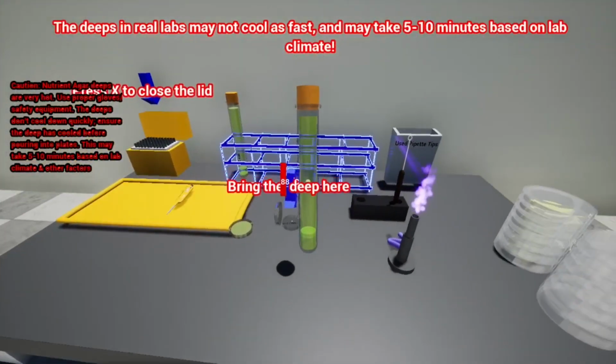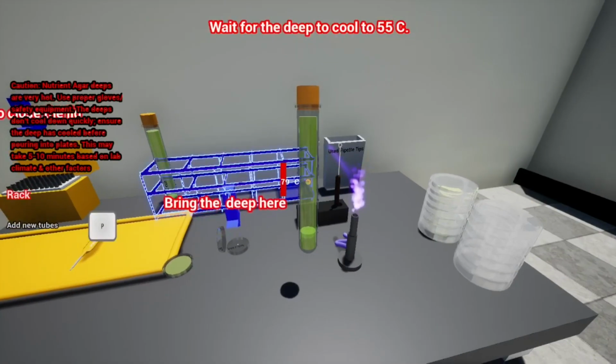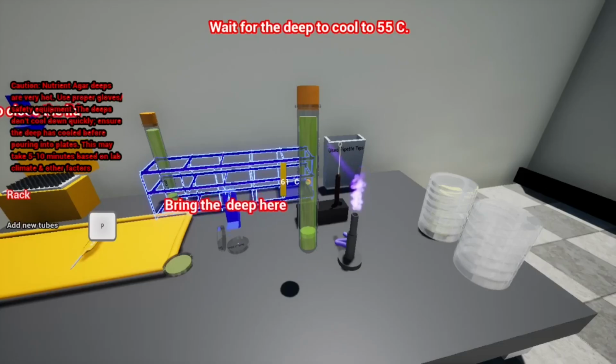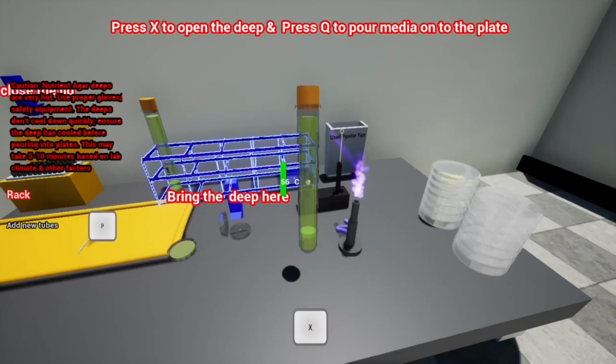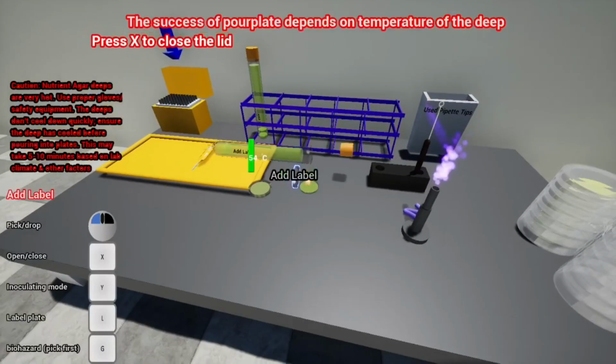So deeps in real labs may not cool as fast and may take 5 to 10 minutes based on lab climate. Again, it's important to note that these deeps, which are very hot right now, may not cool as quickly in your real labs. And again, there are more ways to do this. You can add liquid inoculum directly to the plate or to the tube once it's cooled down. Both will work, and you're free to do whichever method you choose. And just press X to open, and then point towards the plate and press Q to pour plate.